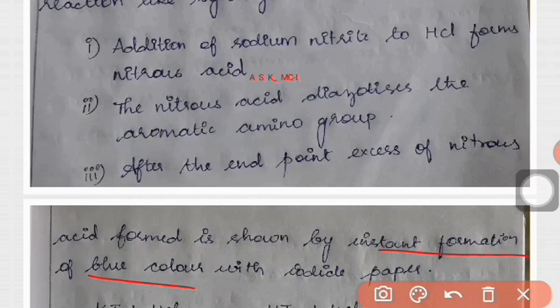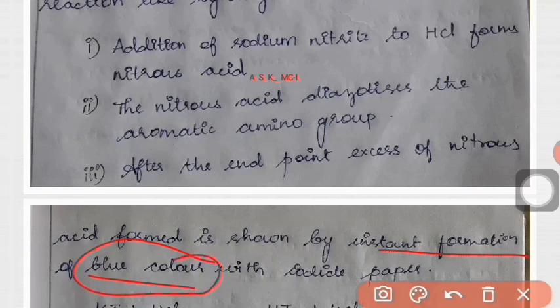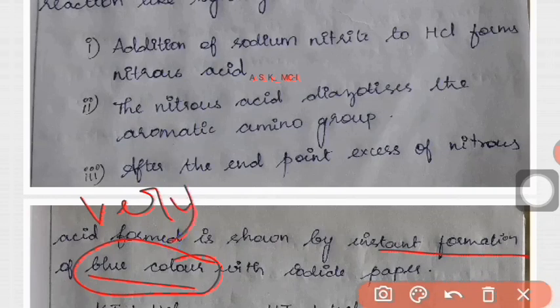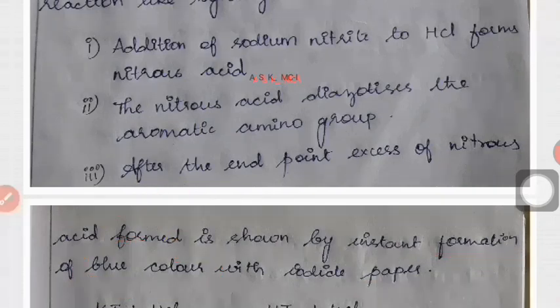One important condition is that the formation of blue color must be very quick. In other words, the formation of blue color must be immediate so that end point can be estimated as achieved. Otherwise, the reaction is still going on.